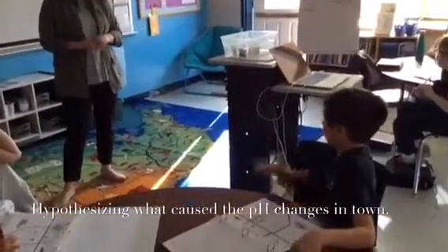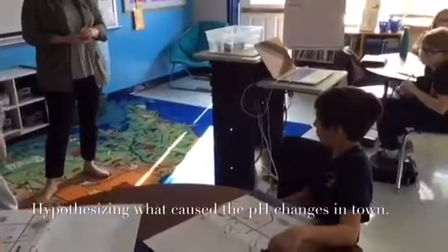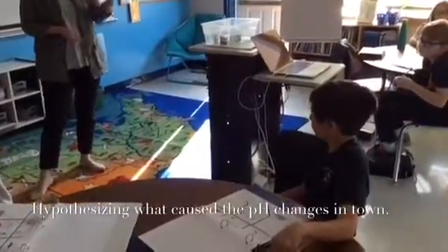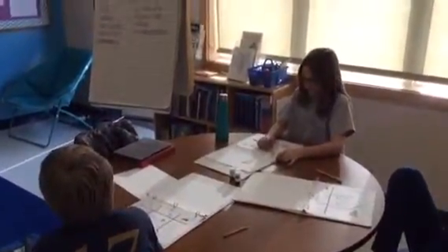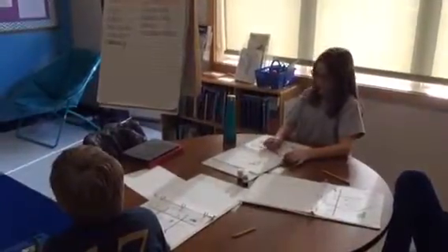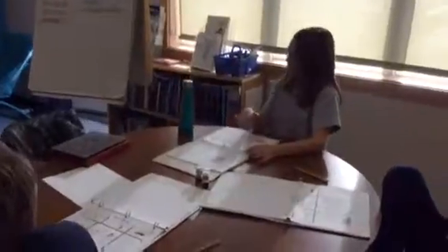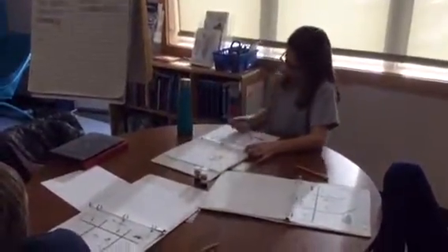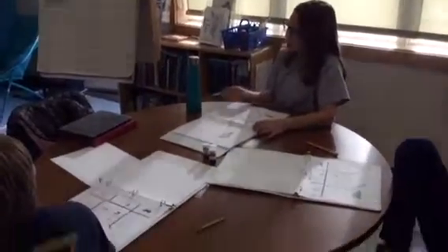Neighborhood B, we read on the chart that they have like a basic line thing. It's slightly basic. Okay. So the Greentown pond only had 4. But I think Kyle was right about the Greentown farm carrying some of the acidic to it, and then plus the acidic already in the pond added up, and they made it 2.